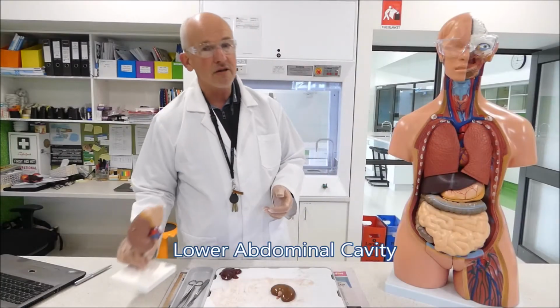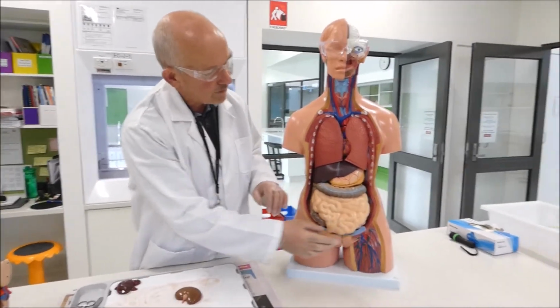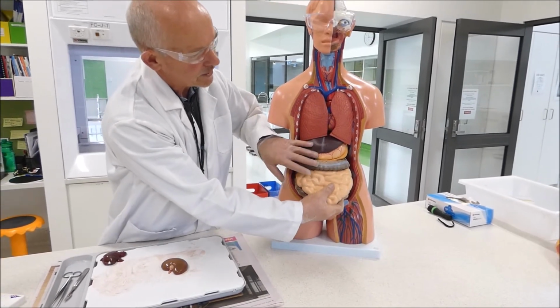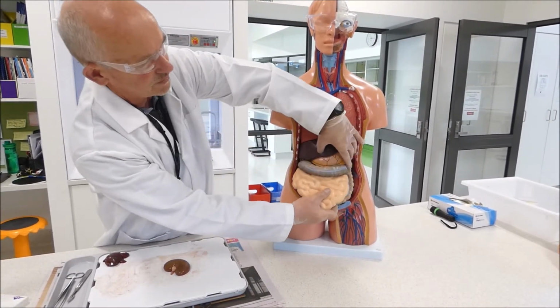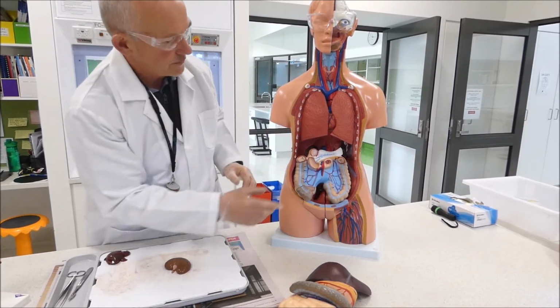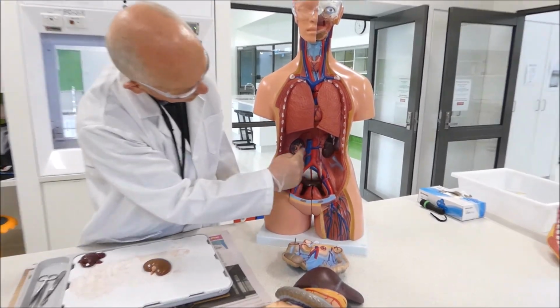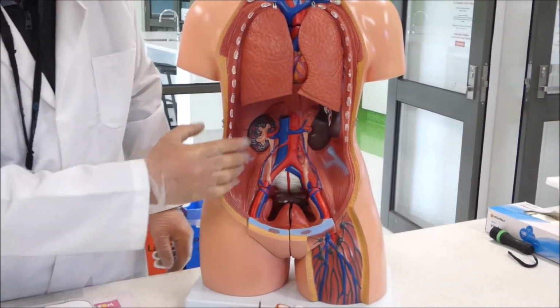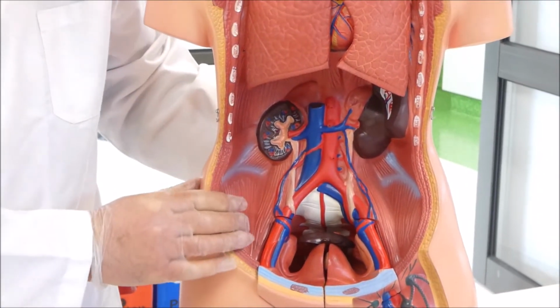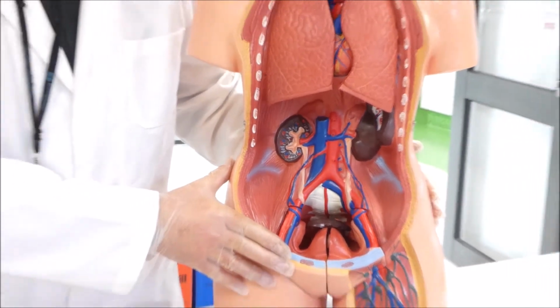Now the kidneys themselves are found in the lower abdominal cavity of the body. If we look over on our friend here, if we remove all the intestines and the liver and such out of the model, we'll just take them out carefully and take out the bottom intestine as well. And the kidneys are these two bean-shaped organs at the back of the abdominal cavity. We won't be looking at a whole sheep when we dissect, but that's the location they're found in the sheep as well.